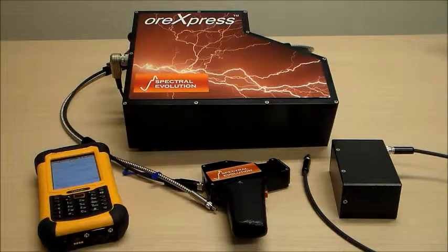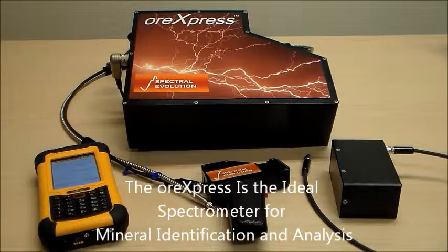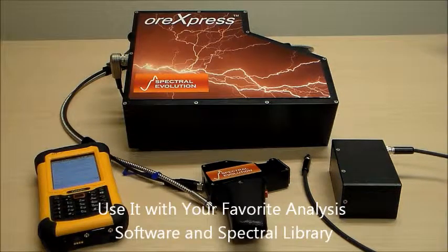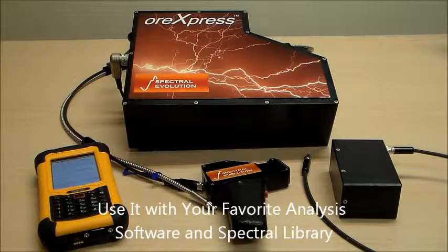The combination of the ORExpress and TSG analysis software gives the exploration geologist a powerful set of tools for effective mining exploration.